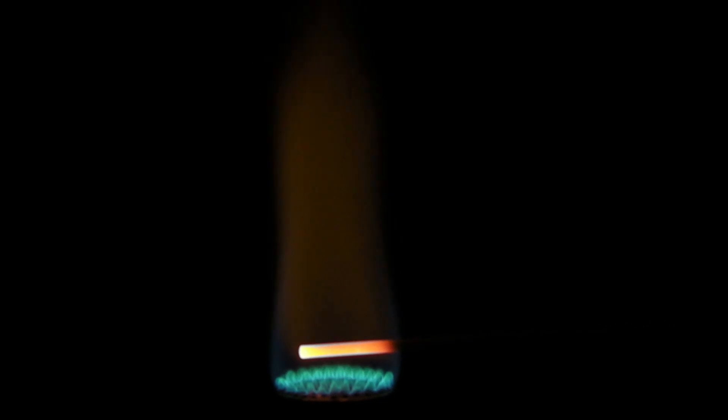Then it can be tried to pick up a few grains of the sample with a glowing stick, or it is made wet with hydrochloric acid after cooling down before picking up the sample. Then the stick is held into the flame of the Bunsen burner and watched through the cobalt blue glass.